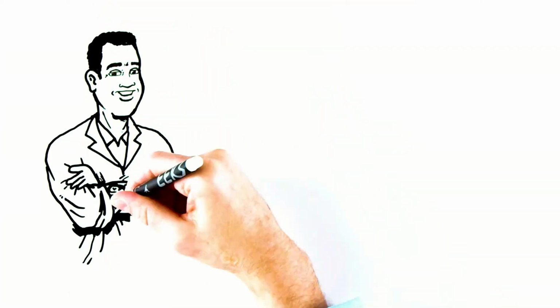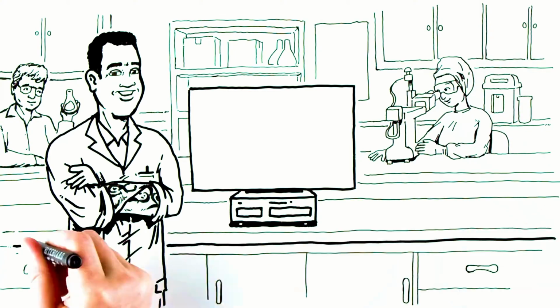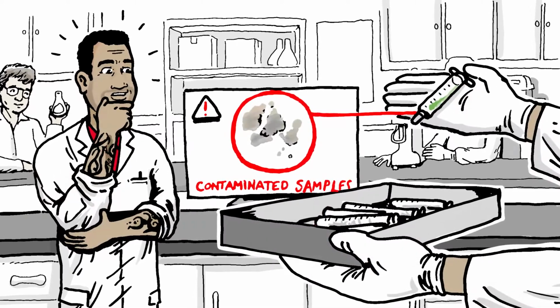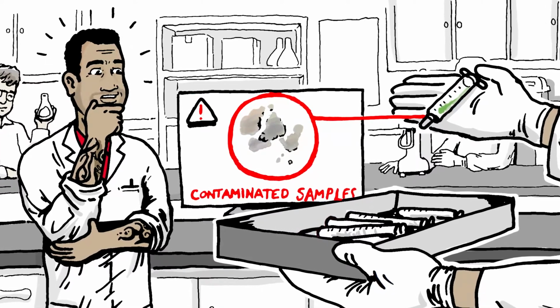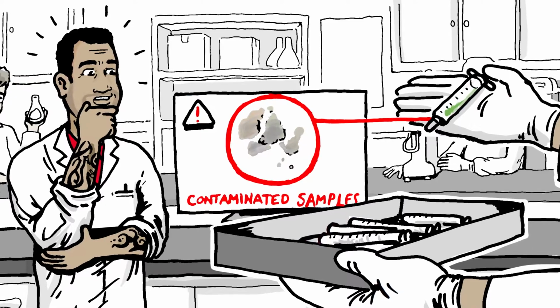Meet Arturo. He directs a lab at a facility manufacturing medical equipment, including plastic consumables. Safety is paramount in such an operation. So when quality control presents several syringes with grayish-brown impurities of mysterious origin, it's up to Arturo and his team to determine the nature of the contaminants for the health of patients and his company's reputation.